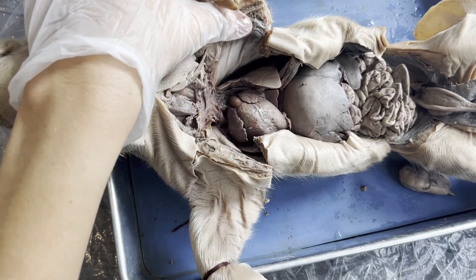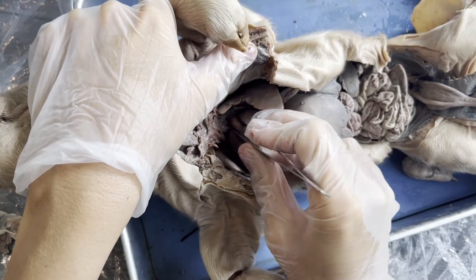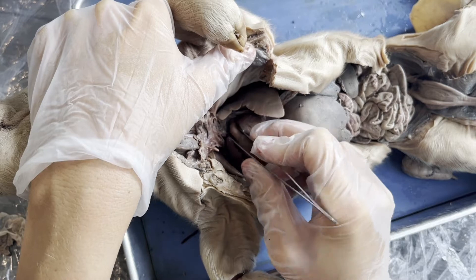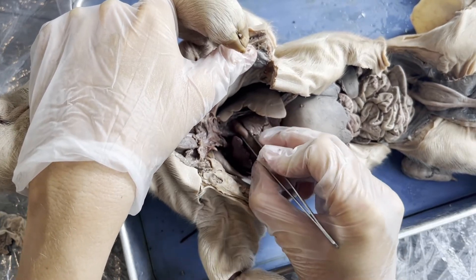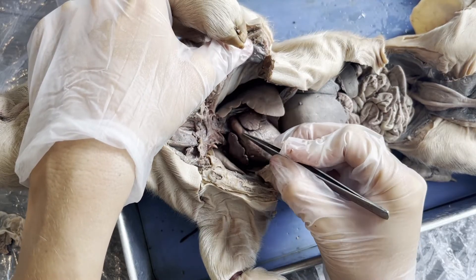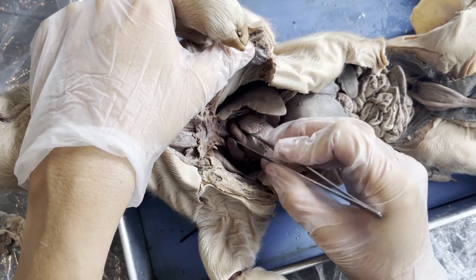The first blood vessel I can see coming out of the right side of the heart is the pulmonary artery. It has a pinkish appearance and is very formed and easy to see. The pulmonary artery is an artery that takes deoxygenated blood from the heart to the lungs — so this is carrying blood that needs to be oxygenated.